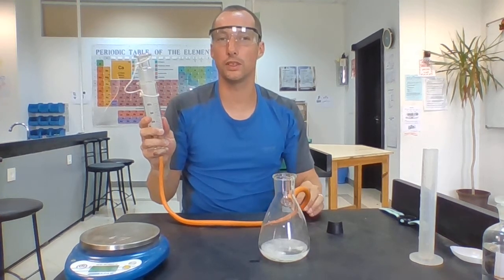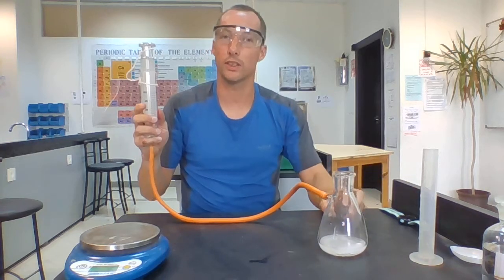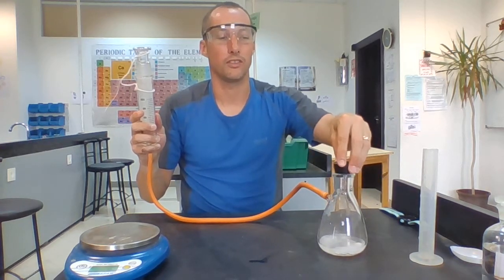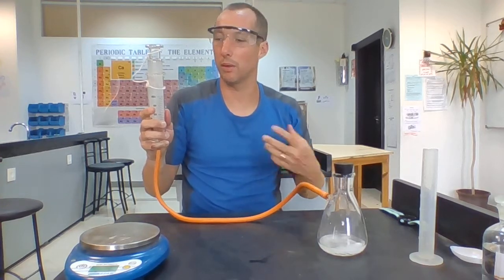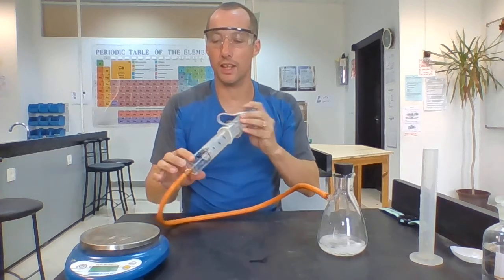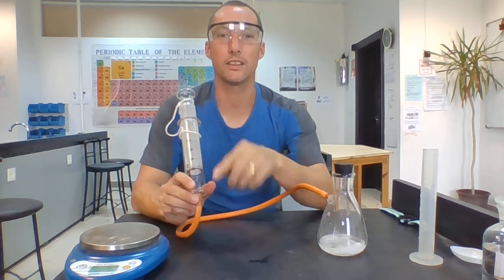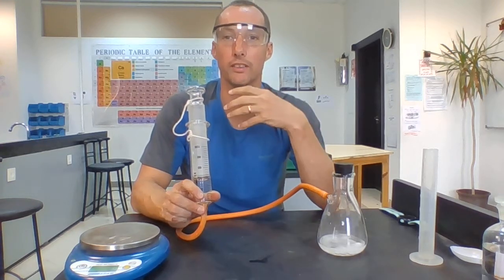Obviously, if there was no gas produced in this experiment, I can't collect the gas. So this can only be used for those kind of reactions in which a gas is produced. I'm also going to show you in a moment a second way where you can do something very similar without using a gas syringe. So this gas syringe is one way in which I can collect gas, and the more gas I collect per second or per 10 seconds tells me the higher rate of reaction.